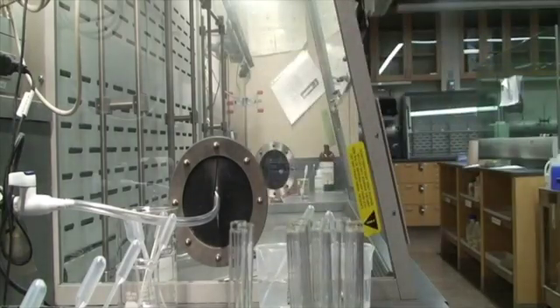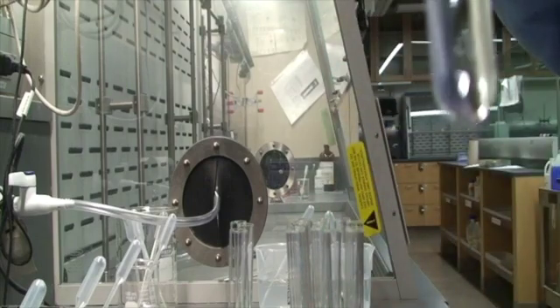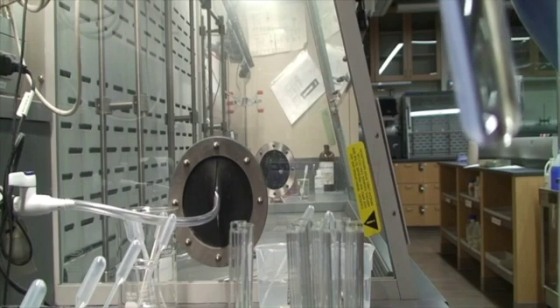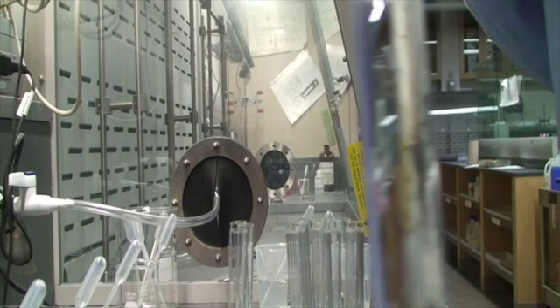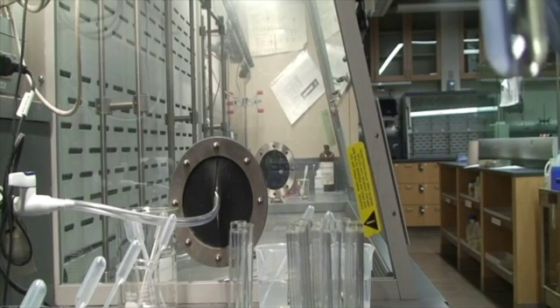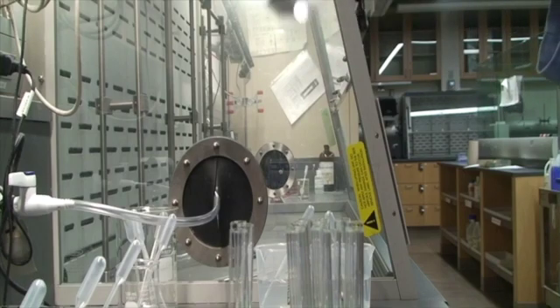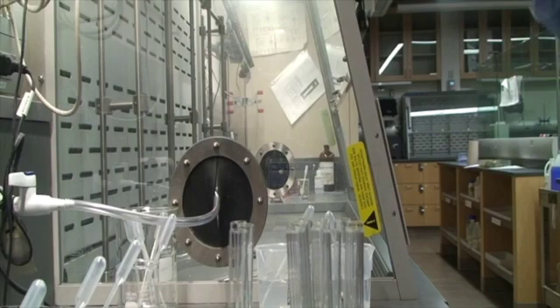No bubbling, I don't see any bubbling. Let's try the smell test. Nope, no smell. Oh, I take that back. There is a smell. It smells a little bit like ammonia. It smells like ammonia there. Alright, so we do have something happening. So we have a nice ammonia smell.